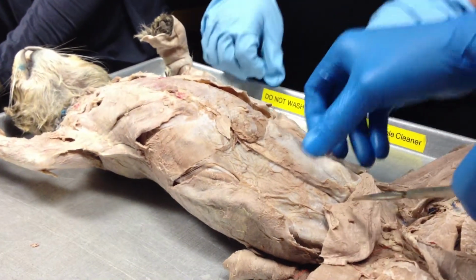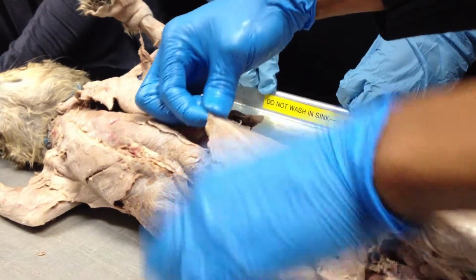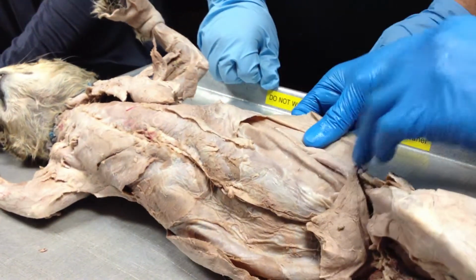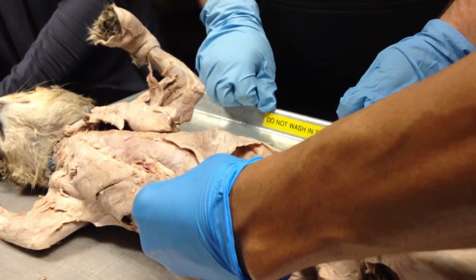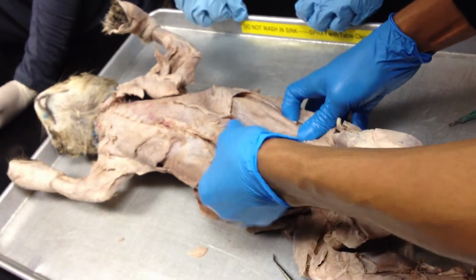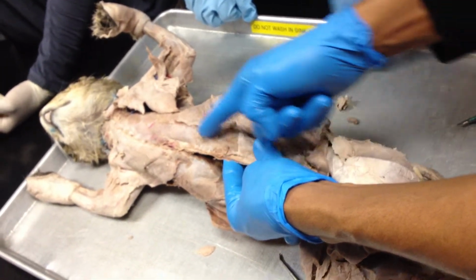The abdominal wall, we have 4 muscles as well, right? We have the first one called the external oblique, the outermost. You see direction of fibers traveling down, okay? And then we have the internal oblique, fibers go up, right? And in the middle here, we can see those fibers traveling down straight. Okay, that's the rectus abdominis.